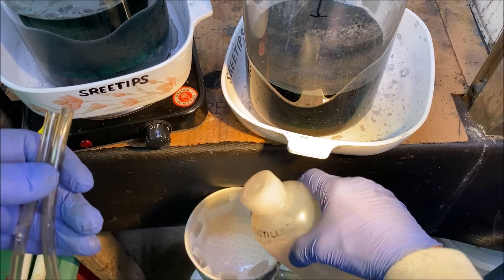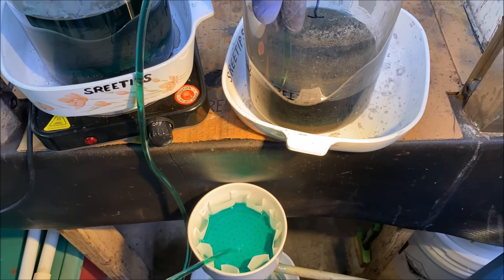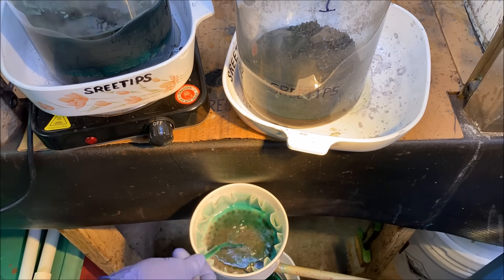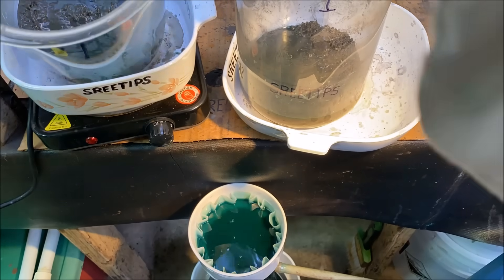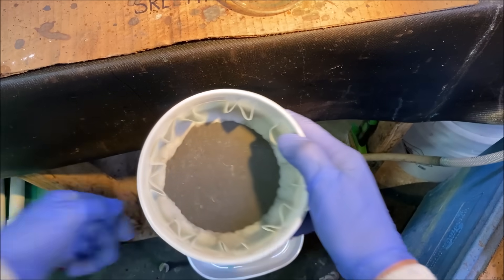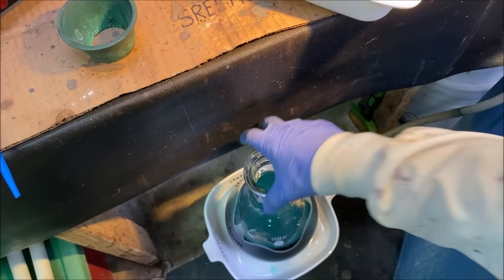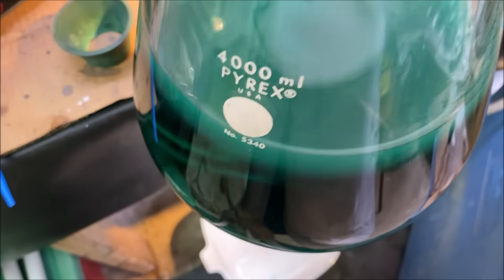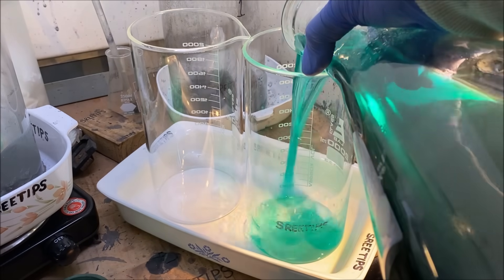We've got a tube of water here. What we're going to do is go ahead and siphon our silver solutions down into this funnel. Here's our filter — that's what's in our filter right there. Set this aside. Here's our solution. We've got a nice layer of precipitate on there because I made a mistake and rinsed the filter out with water. I'm just going to go with it and transfer this solution now into these two beakers.